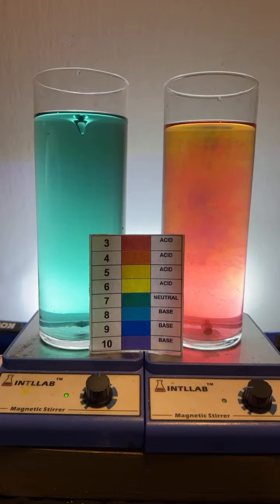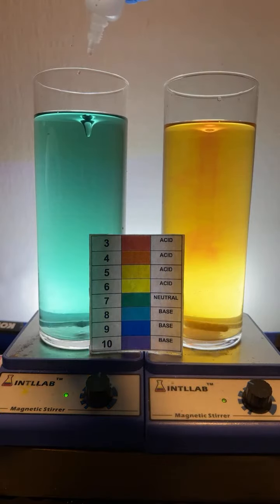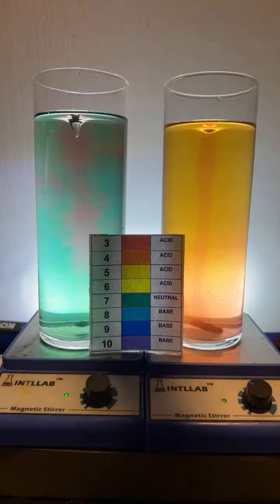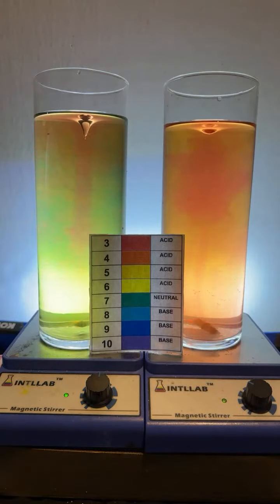Jim Bro says make both the rainbow. Double rainbow, huh? You all are challenging me, huh? We got pH 8, Zach. We got it. That's a good idea, Aviation. I may try that. Can I do orange? Oh, boy. All right. Folks want a double rainbow. All right. Goodbye, teal. We're going to add a little bit of acid over here on the left. We're going to add a little acid over here on the right. We're going to try to do double rainbow. Never done that before. I doubt it's going to work.